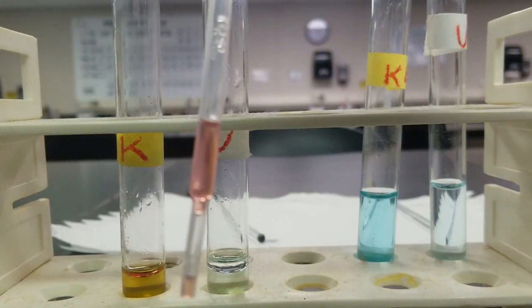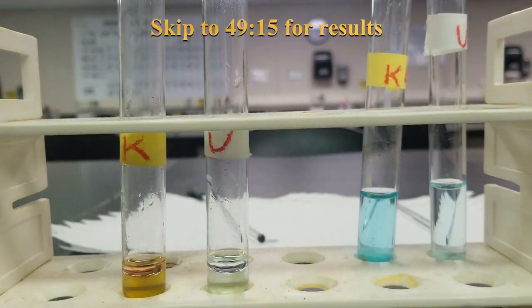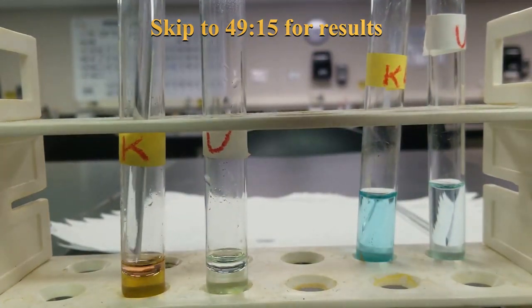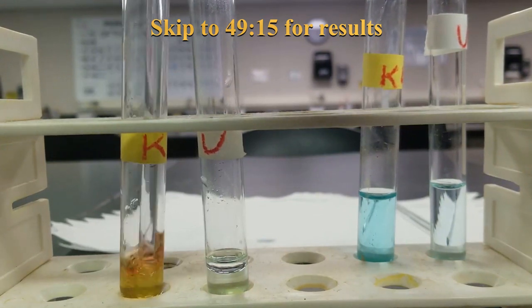All right, you can see, get rid of this, add some more toluene in here. Agitate it. What you're doing here is an extraction. If you take organic chemistry, you learn about this some more.